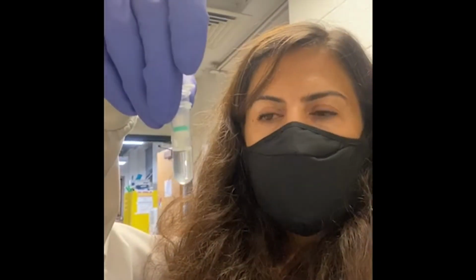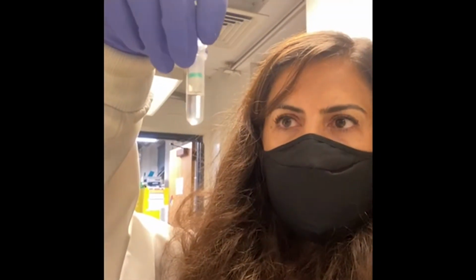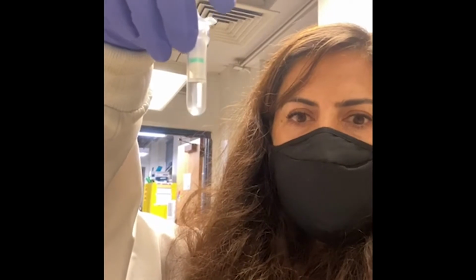So centrifuge is done, and now I'm going to remove my samples. As you see, it has a liquid part. Now it's filtered, and I'm going to discard the flow through, keep the column, and load the rest of my sample to the column, and centrifuge, do the same thing.